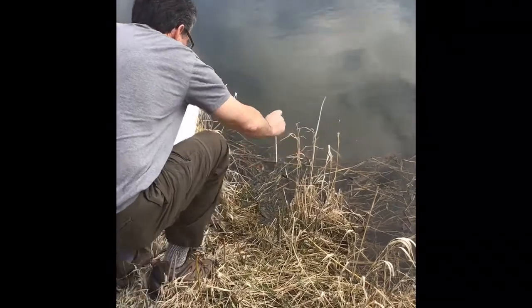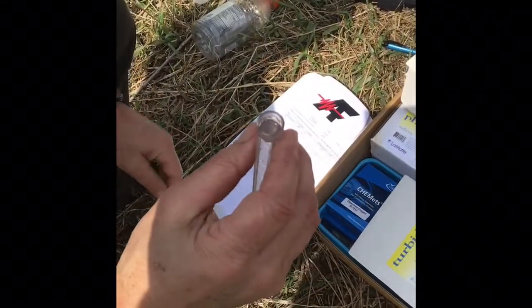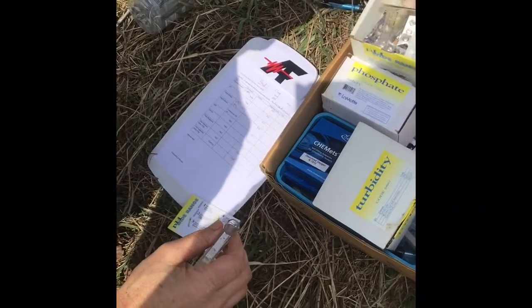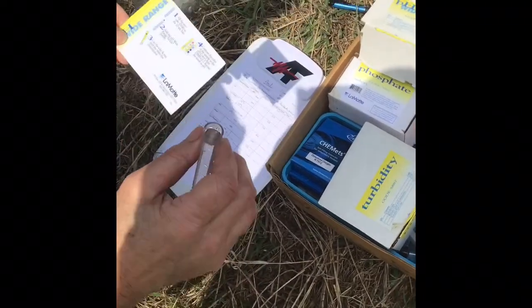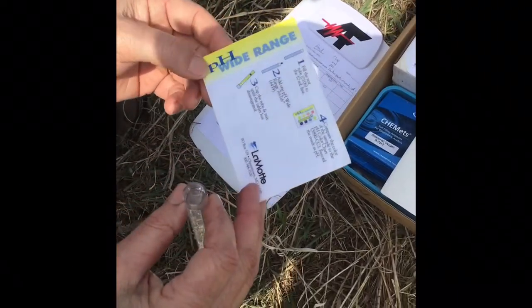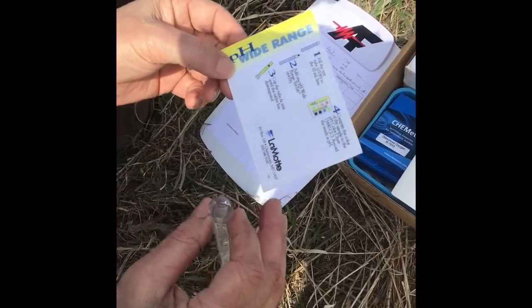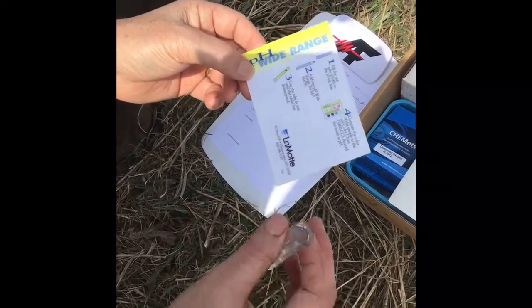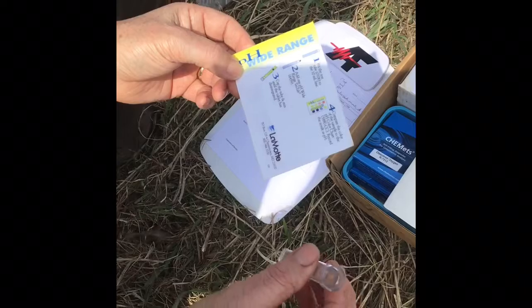Yeah, 15, 14. So next we're going to do a pH test. I've got about 10 milliliters of the pond water in here, and it's pretty simple. Most of what is used to determine these tests is what's called the LaMotte test kit, and it's like our soil test where we use a lot of tablets and indicator reagents and so on. So this is real simple.